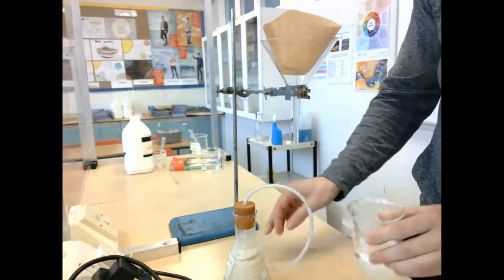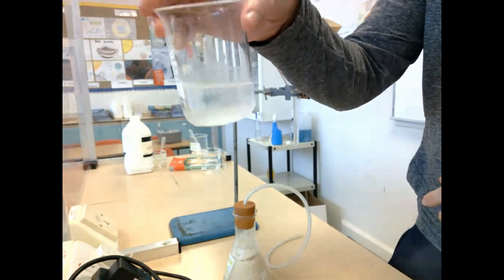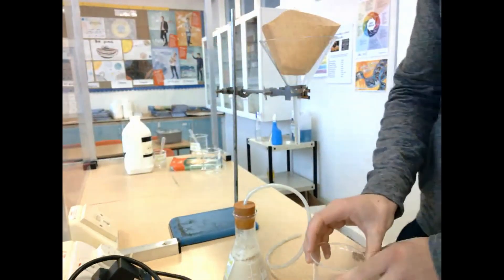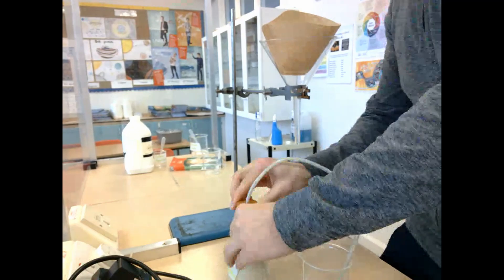So we left this reaction running for a few hours and we knew it was finished when there was no longer any bubbles being produced. As you can see, carbon dioxide was being produced because the lime water has turned a nice cloudy solution.